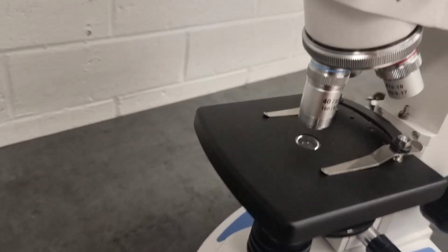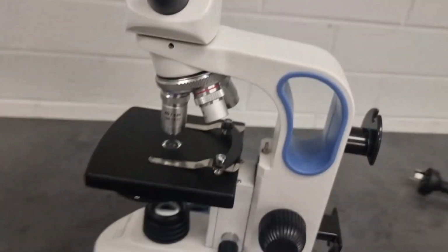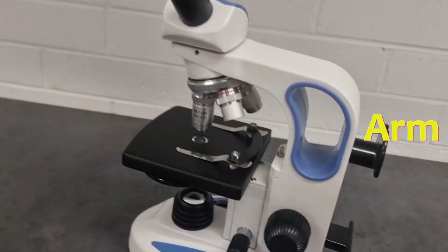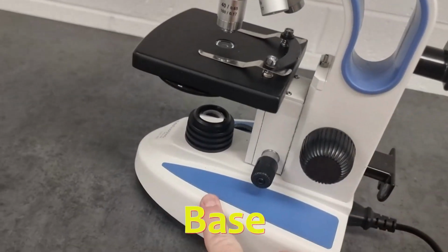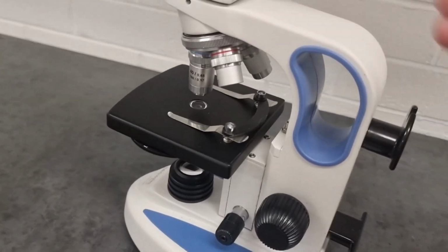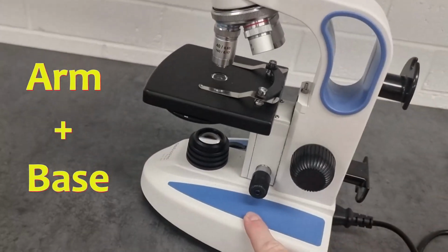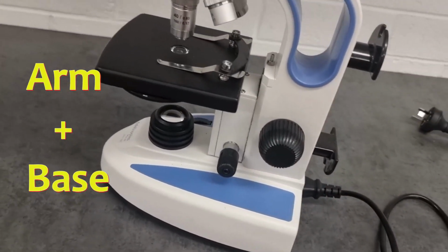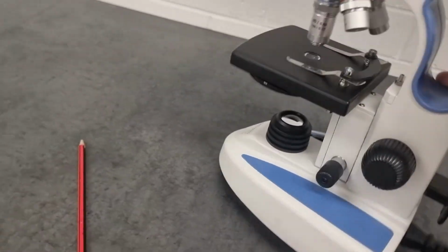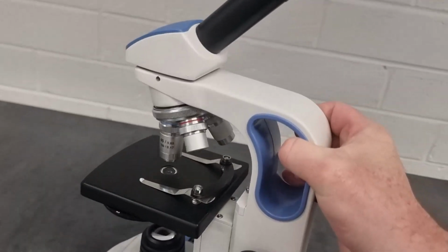All right, what else do we need to cover? I think that's about all. Actually, one very important thing. This is called the arm, and that's the base. And the very important thing is, well, how do you carry a microscope? The arm, the base, both together. You don't just rock around holding it one-handed like this. Please don't treat a microscope like this.